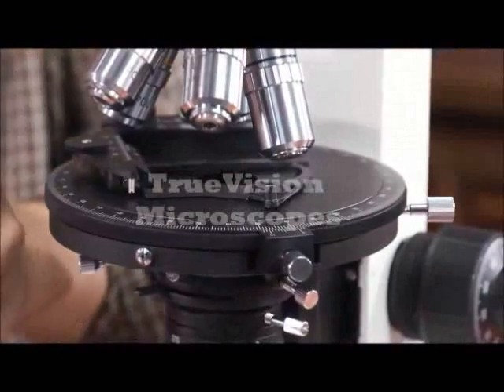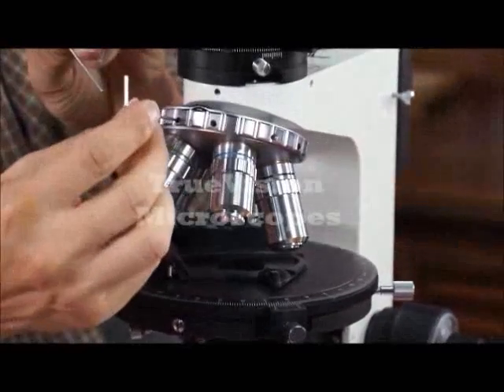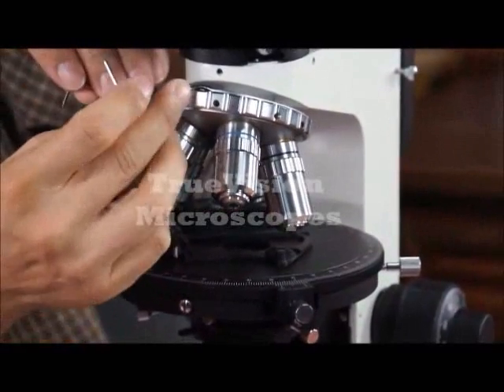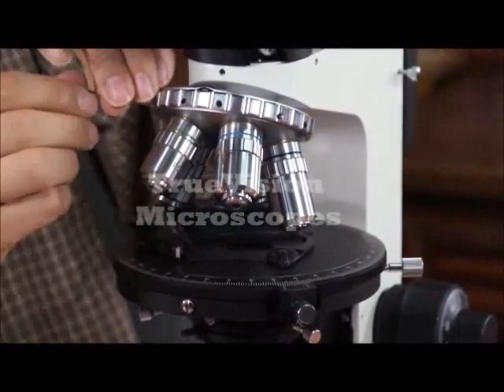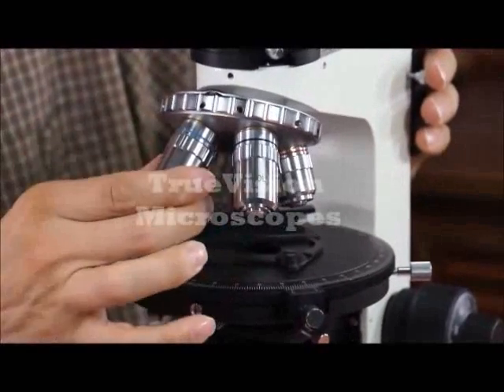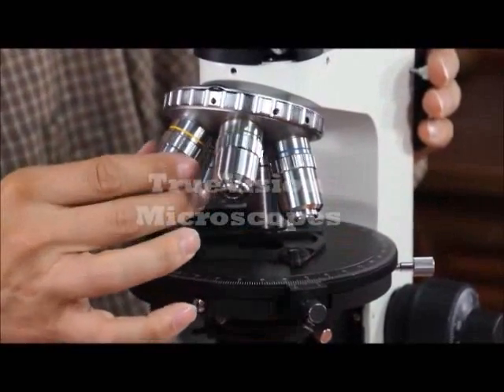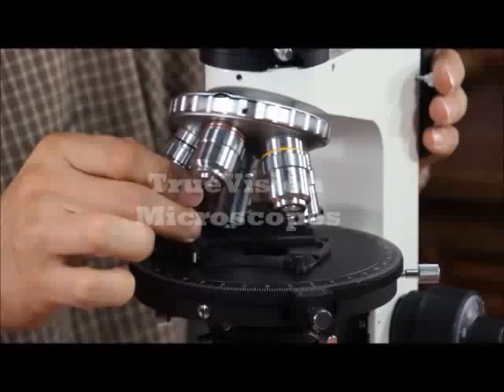As needed, you have adjustments on the objectives that can be used for centering the objectives. We have a 5 power, 10 power, 20 power, 40 power, and 60 power.